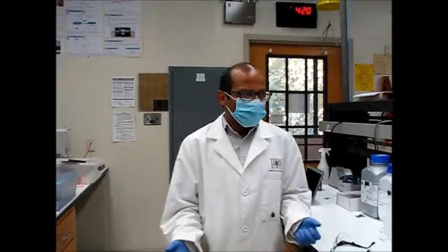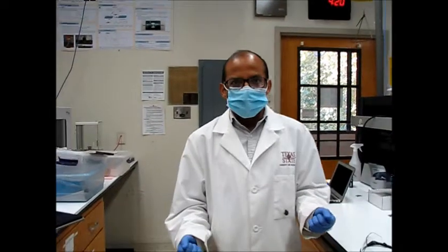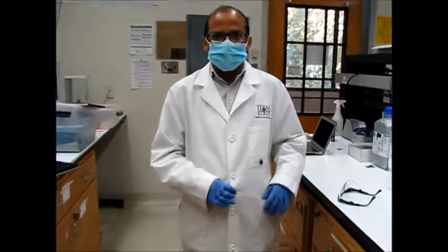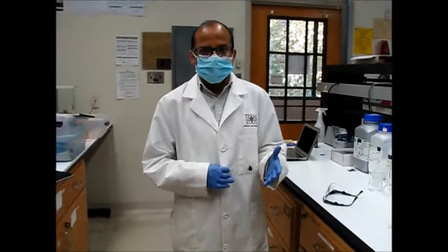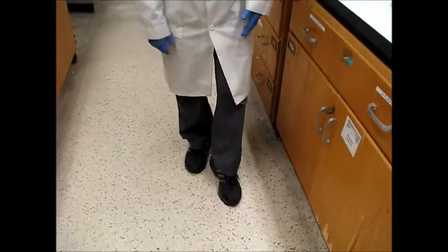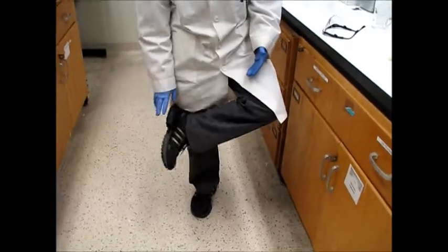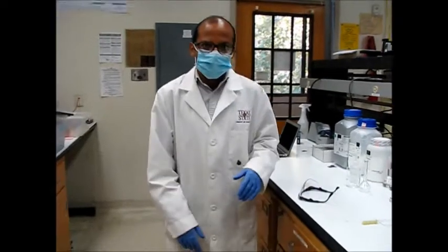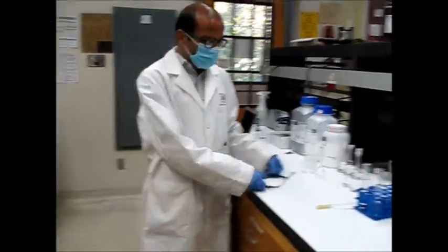Before doing any lab experiment, we need to protect ourselves. Use a lab coat, gloves, full pants with no ankle openings, and closed-toe shoes. Use a face mask because of COVID-19, and wear safety glasses. Now we are ready to perform our experiments.